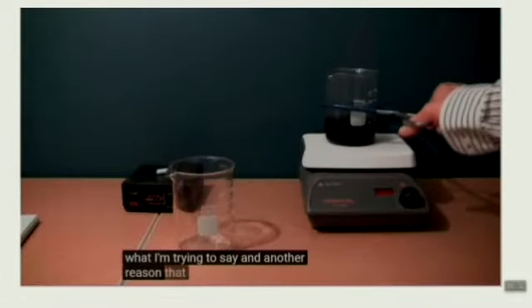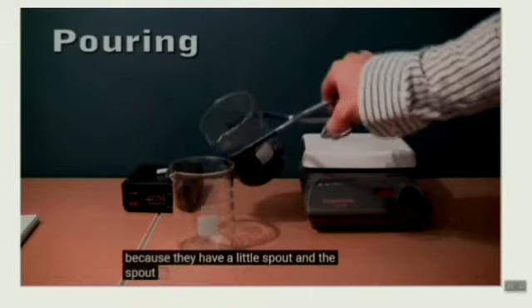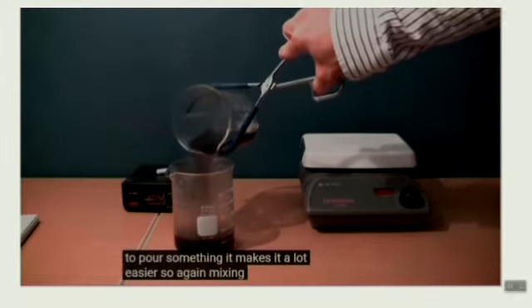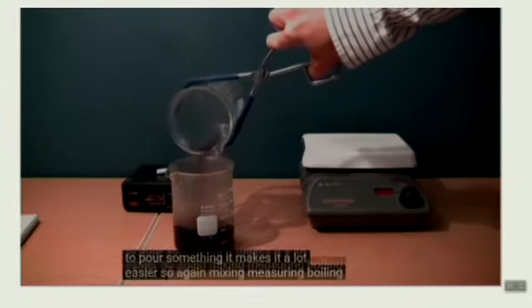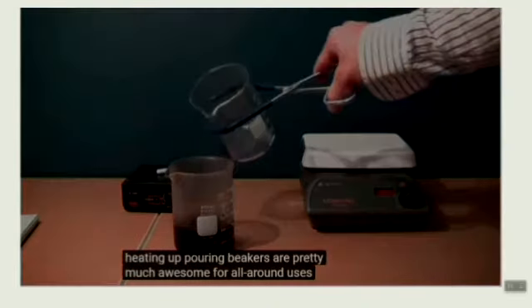Another reason that I really love beakers is because they have a little spout. The spout is really good whenever you want to pour something. It makes it a lot easier. So again, mixing, measuring, boiling, heating up, pouring. Beakers are pretty much awesome for all around use.